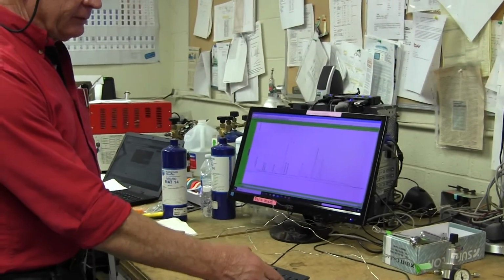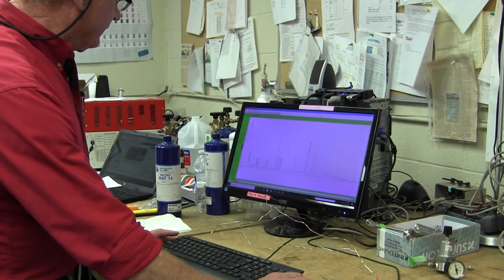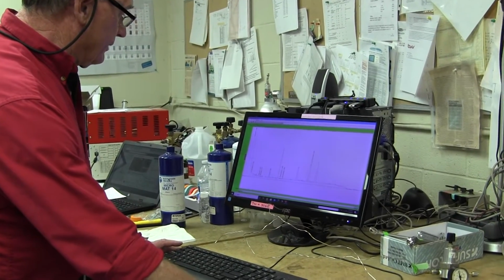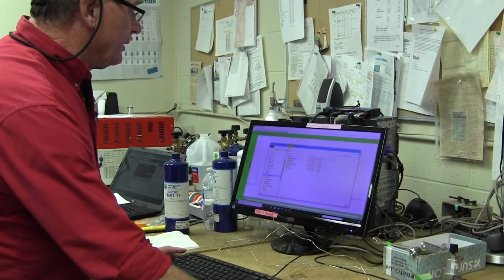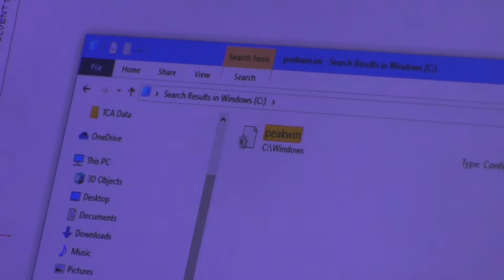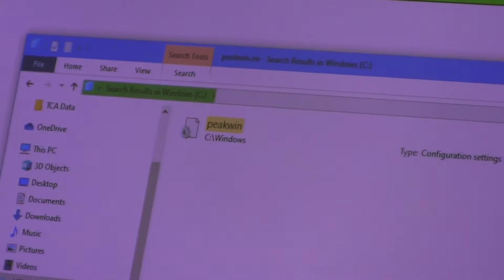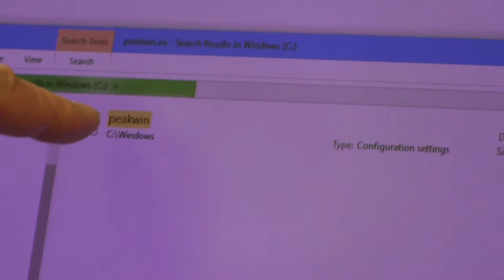In earlier operating systems like XP, it was very easy to find this file. But for some reason in Windows 10, this file is buried in a very obscure location. So to find it, we have to click on the File Manager and then go to the C drive, and then up in the right there's a search window. So we type in PEAKWIN.INI, that's PEAKWIN.INI. So you hit enter, and then it starts looking for a file with that name in all the different locations in the C drive. And it puts where it finds those right here in this little list.